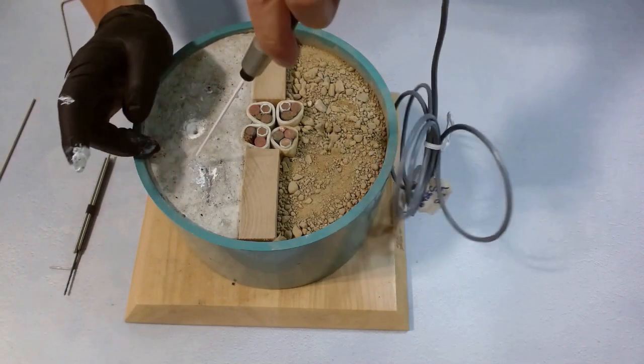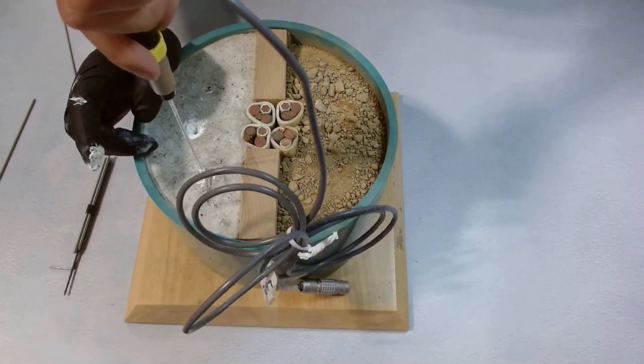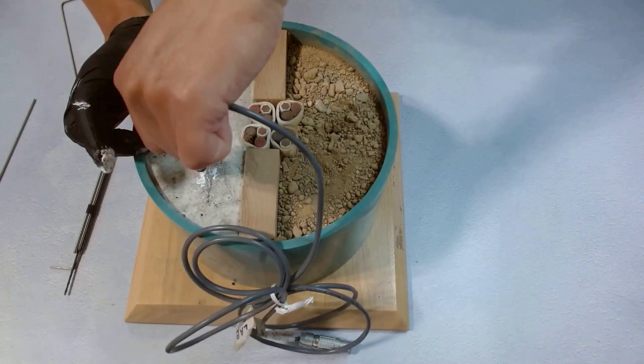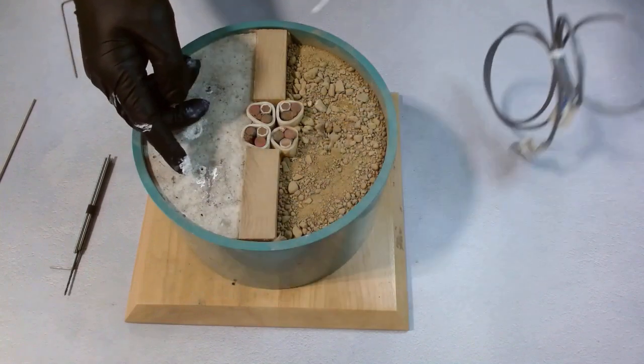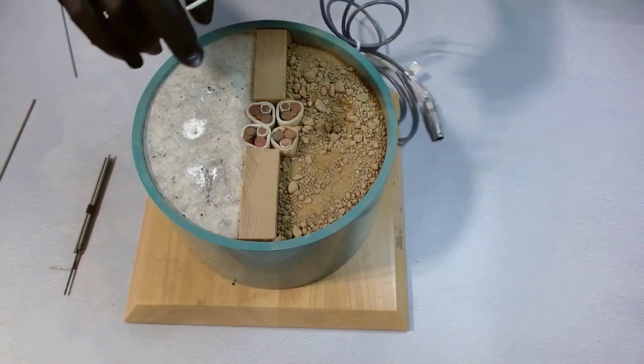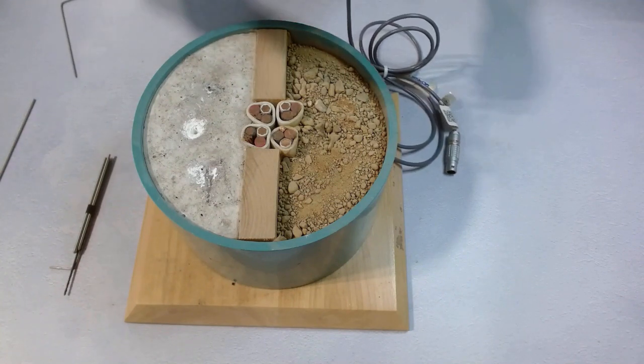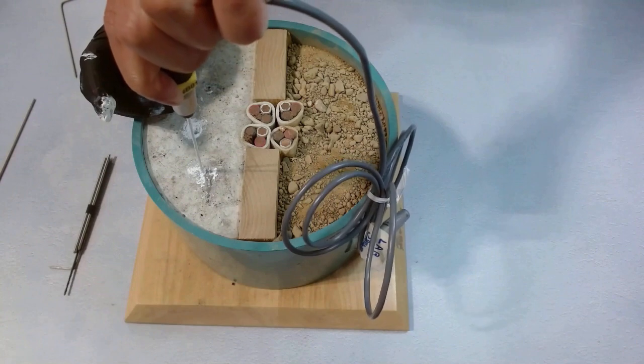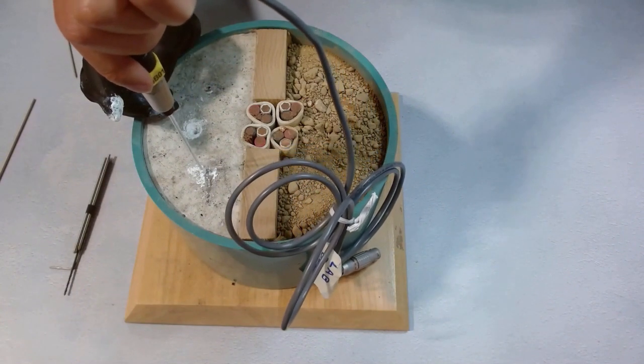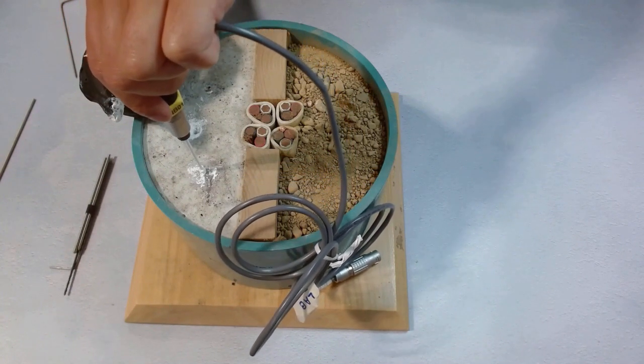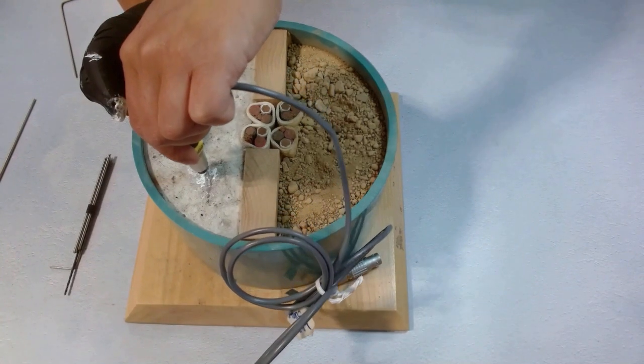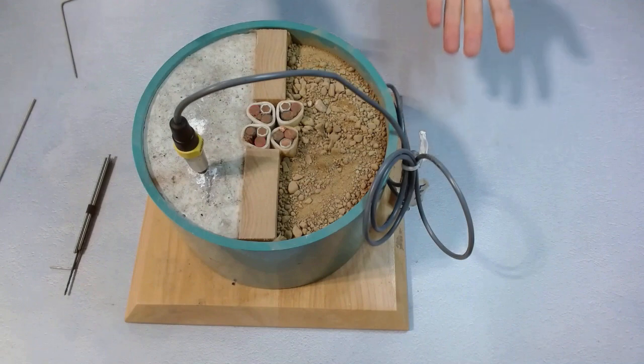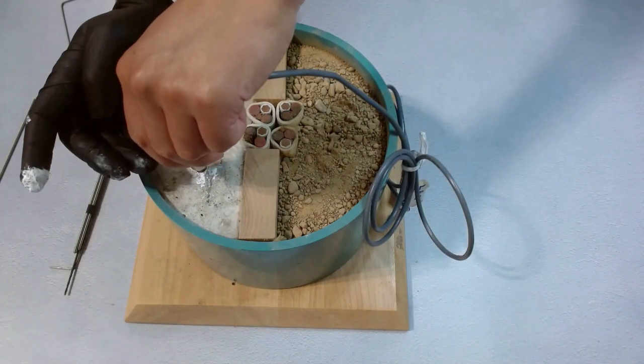We stick it in gently. Give it a little motion. Don't twist it so much so the cable wouldn't get caught in anything. We try it for the last time. It's almost covered entirely this time. We go in straight again. Give it a little twist and in-and-out motion to get the paste evenly spread. Now it's sitting there pretty well. We can perform the measurement.